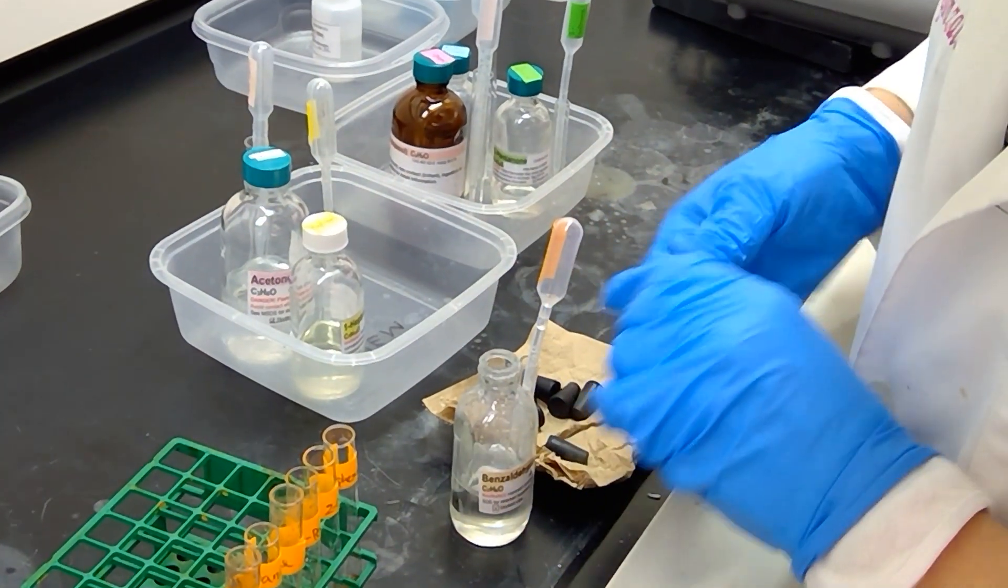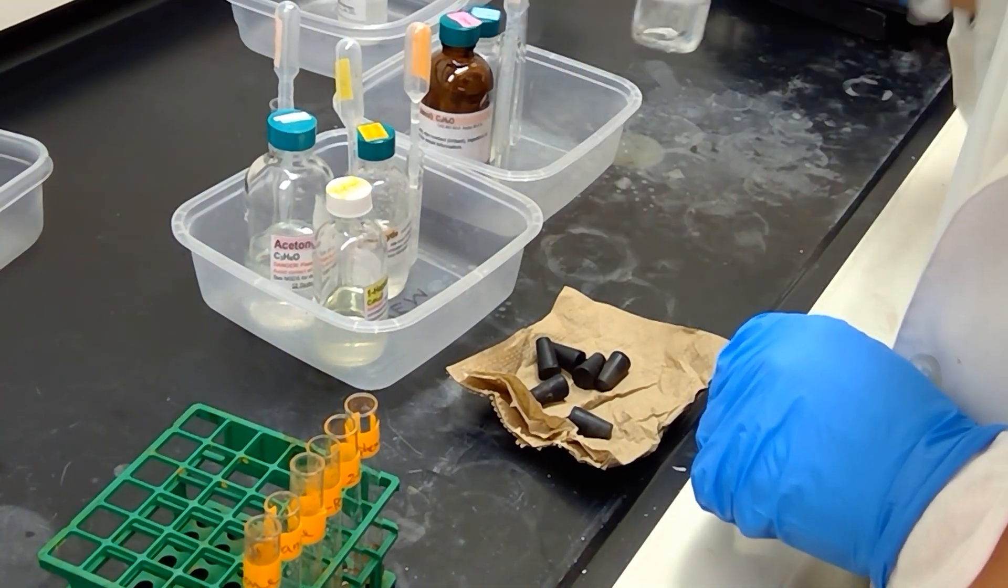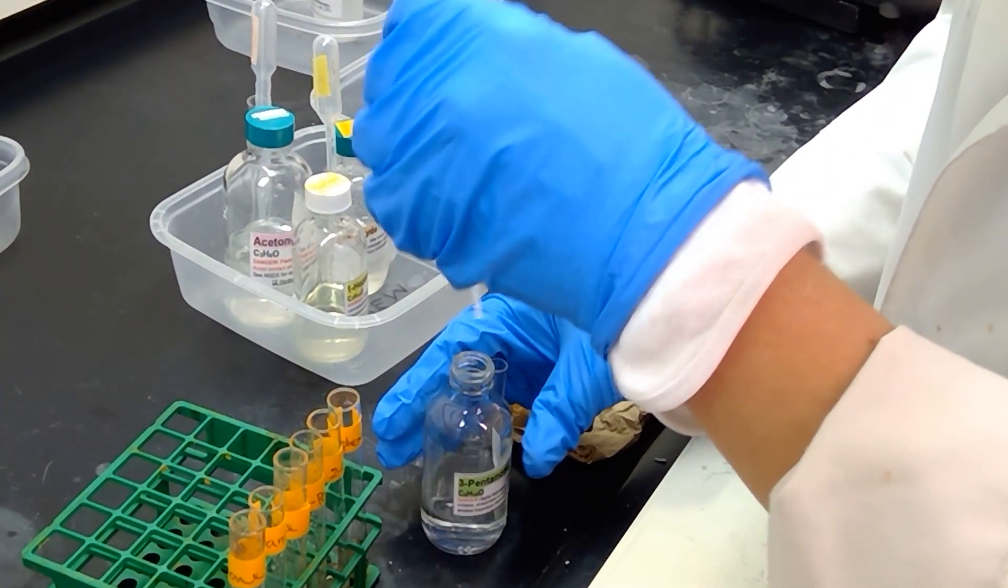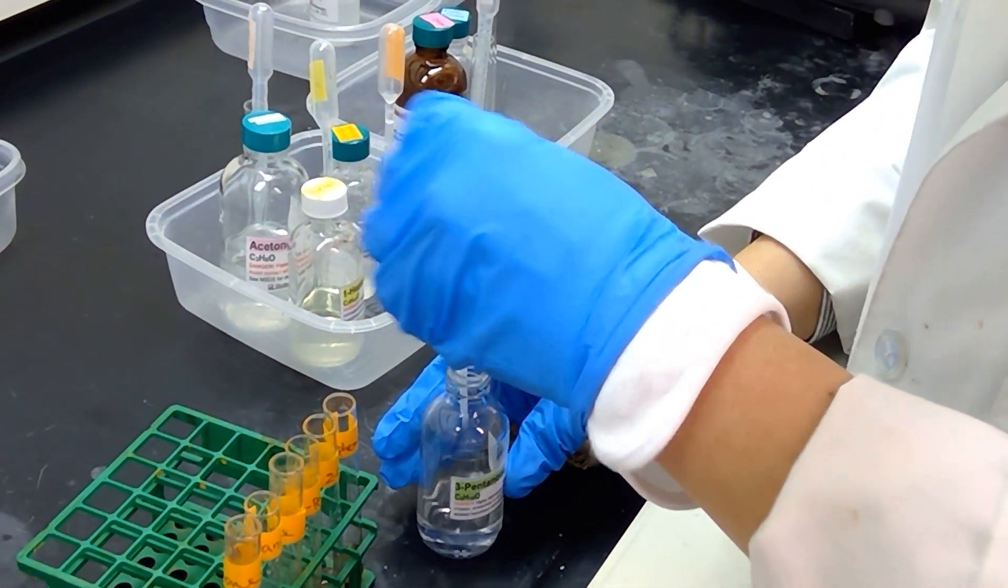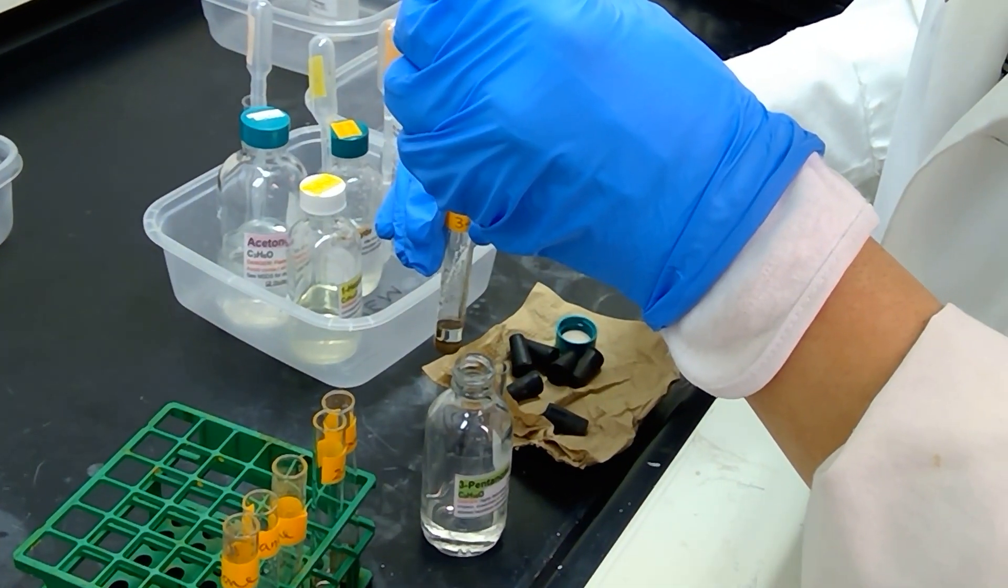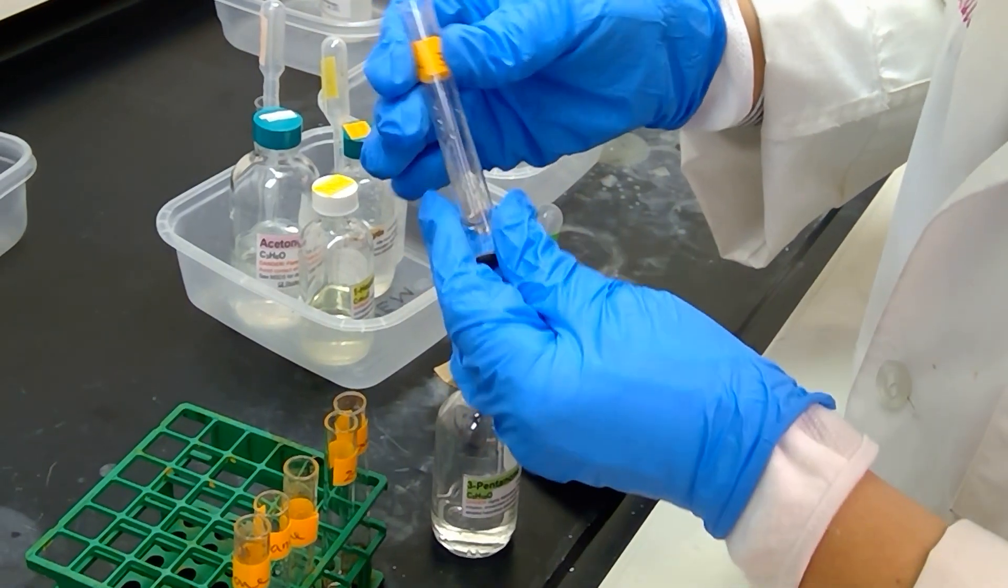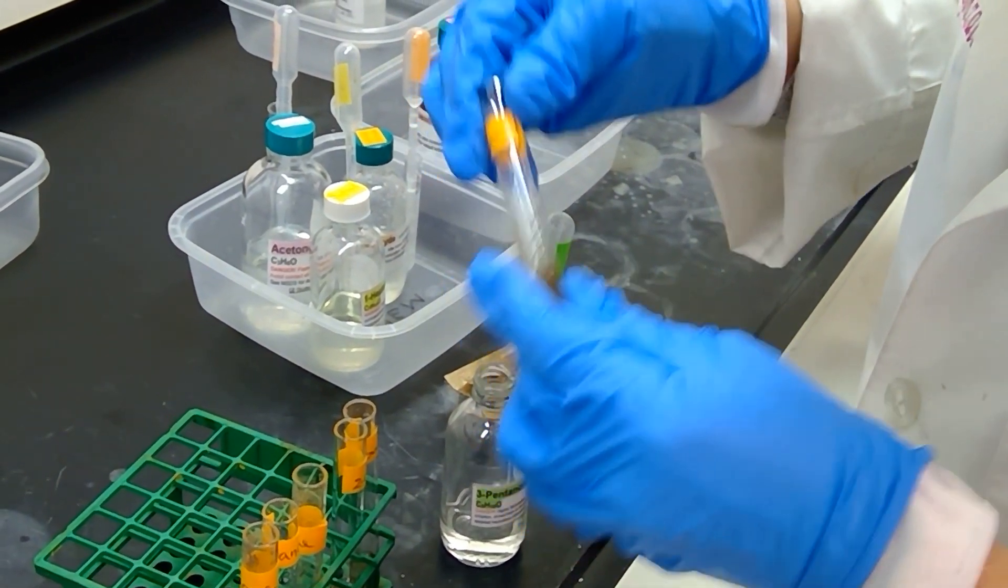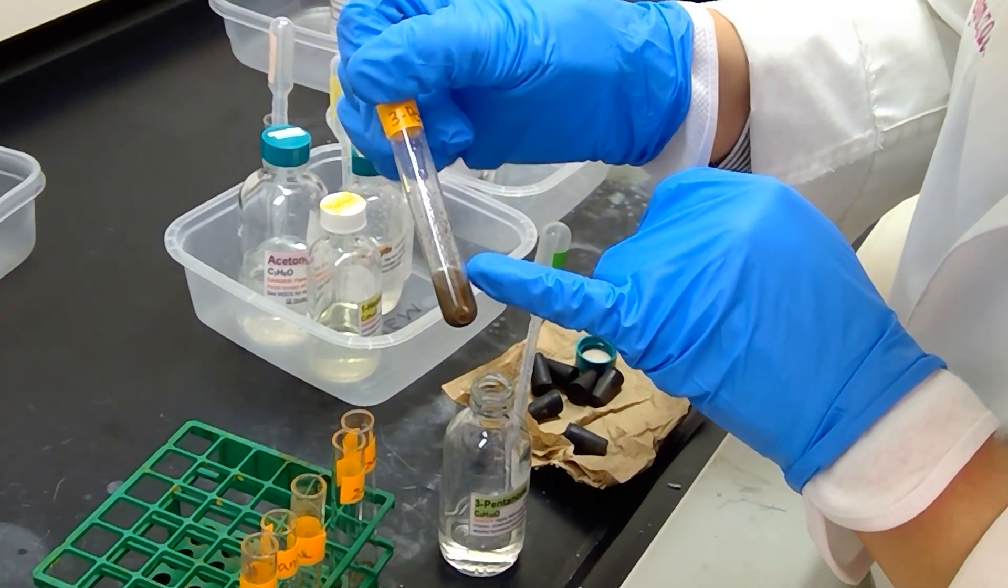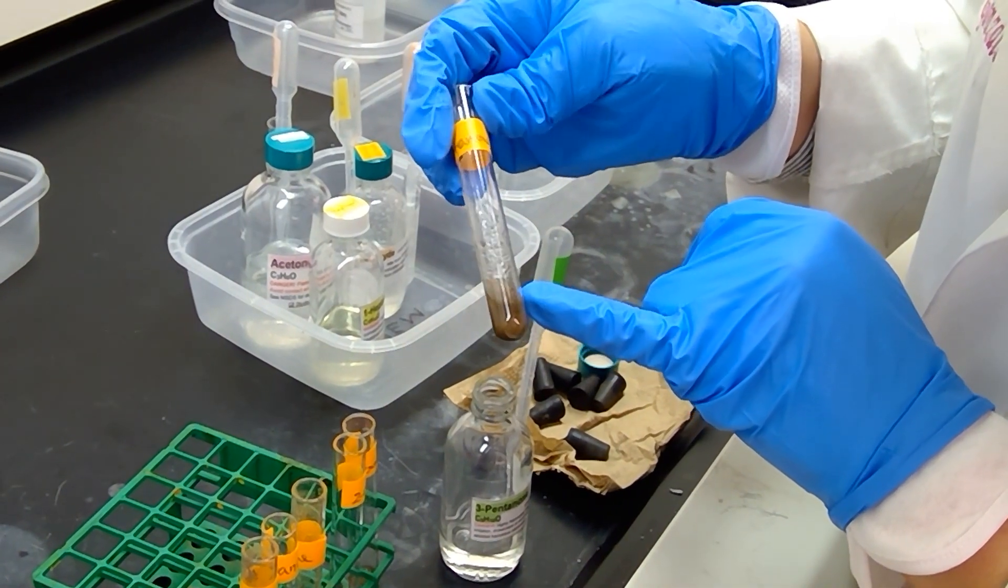Let's move on to our next sample, which is 3-pentanone. 3-pentanone is a ketone, so we do not expect a precipitate to form in this case. But we will see. Let me shake it up just slightly. We do not see any precipitate happening at all with the 3-pentanone.